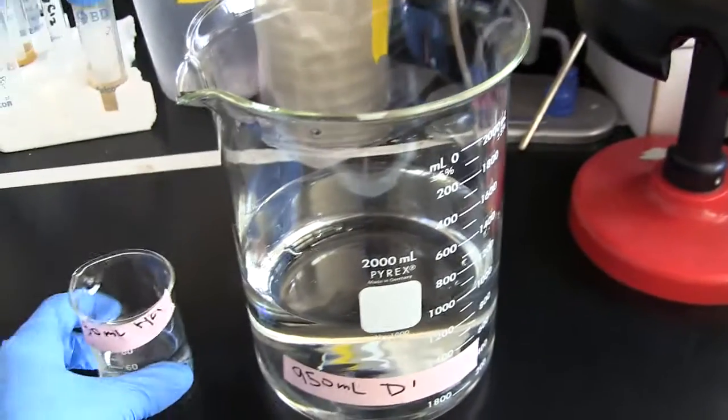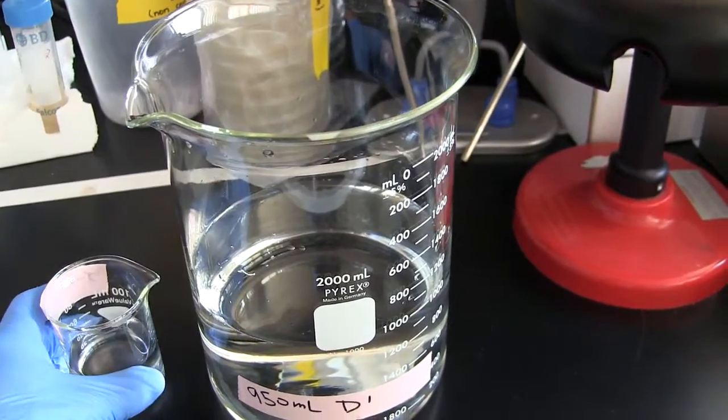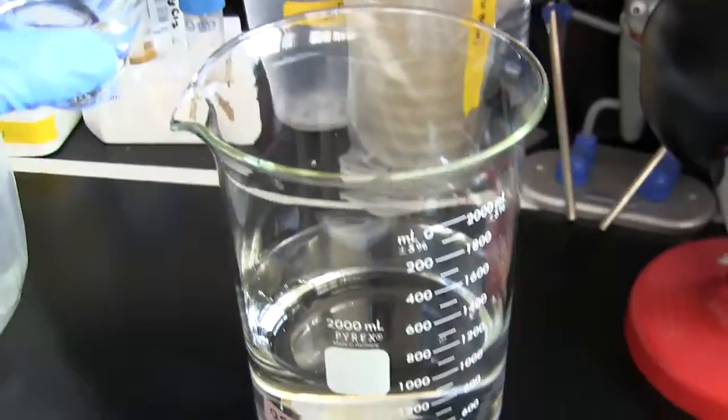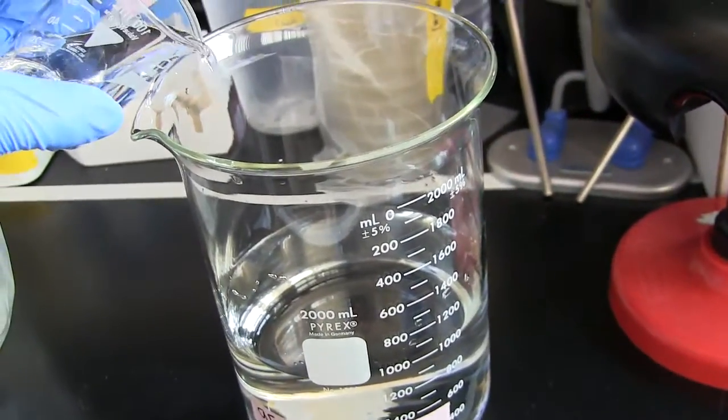So what I do is, wearing gloves, I take my 50 mils of hydrochloric acid and then I pour it slowly into my distilled water.